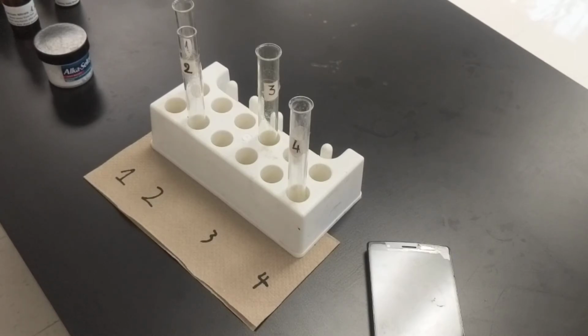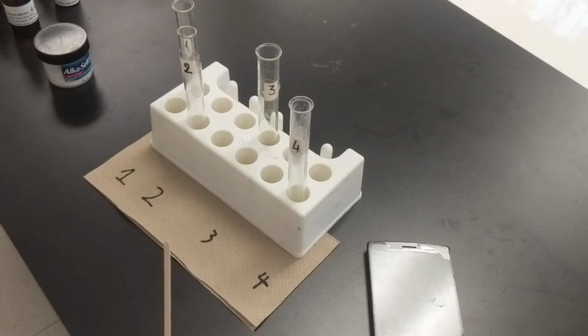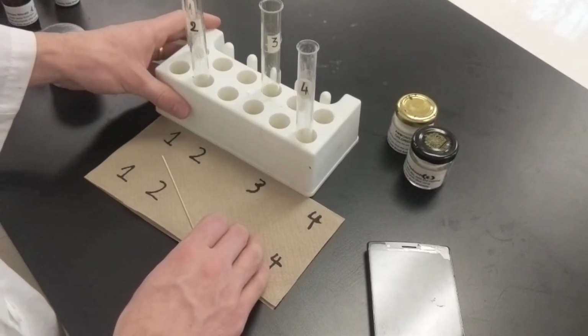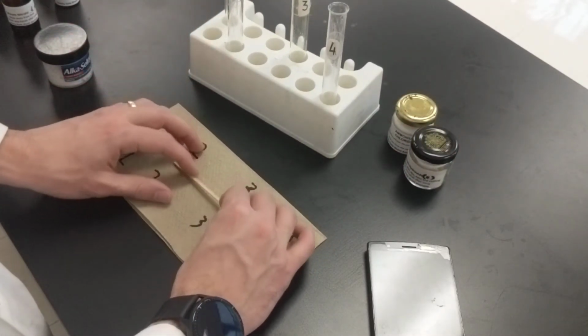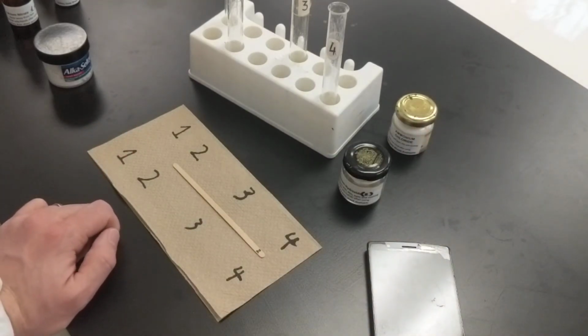All right. Now, this is the last step: use side marked A on the wooden splint. That's this here. To add a pinch of calcium hydroxide. I believe we're going to be using these last two, but let's just give it a second here. So this is calcium hydroxide to the mortar.